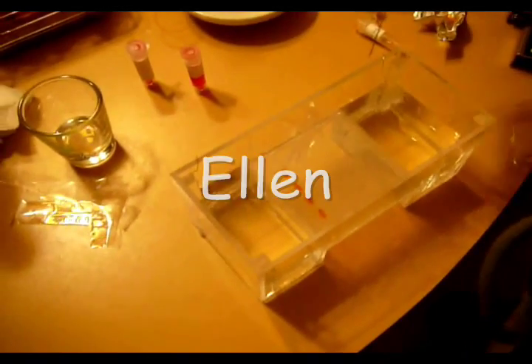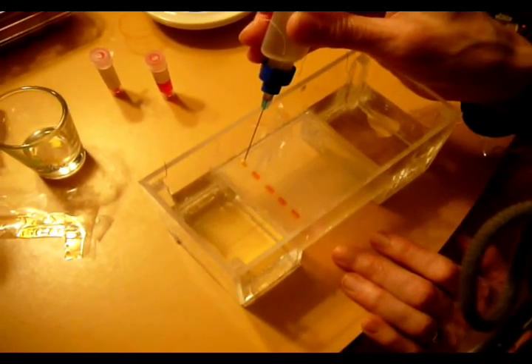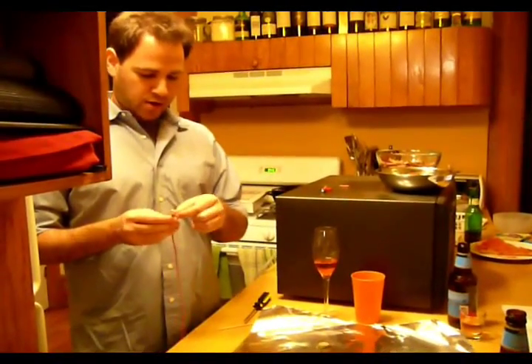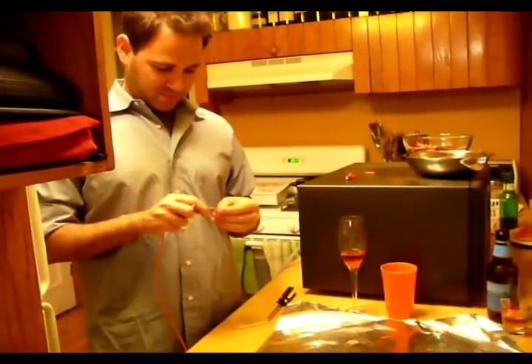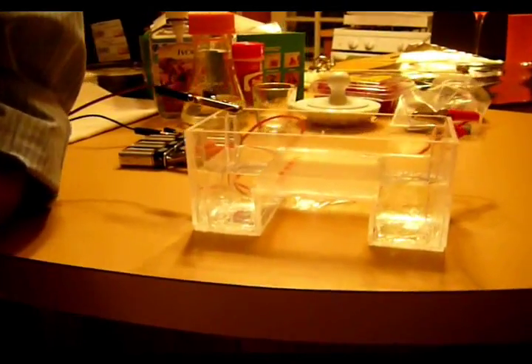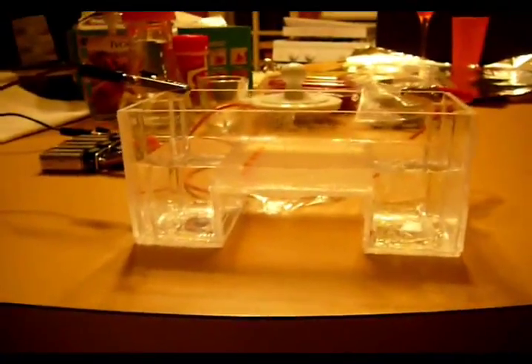It should be filming — is it? Yeah. Let's just do this one last lane if there's another lane there. Yep. Whee! How are we going to pour into it? It has a different hue. It could be less — I think I probably just put less in there. You can actually see the bubbles forming on the negative electrode if you look. A whole lot of tiny bubbles.